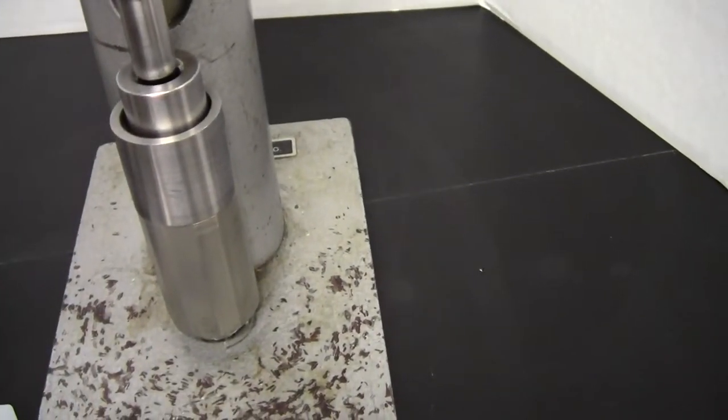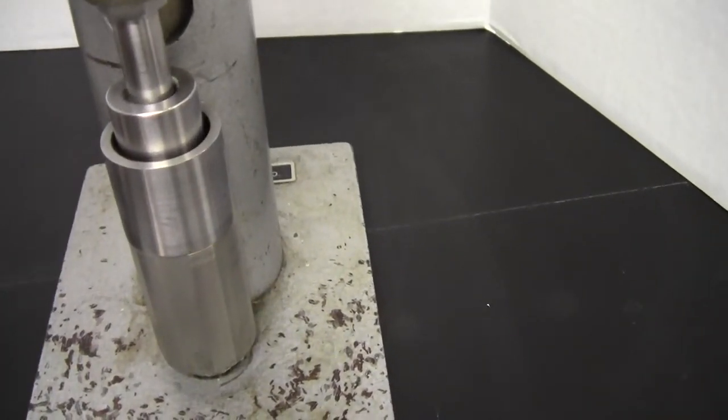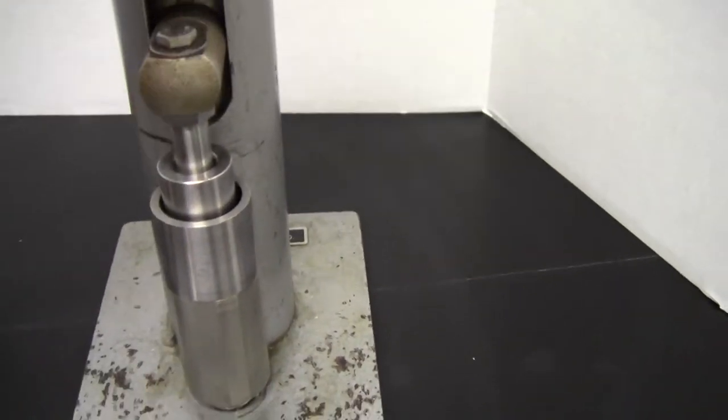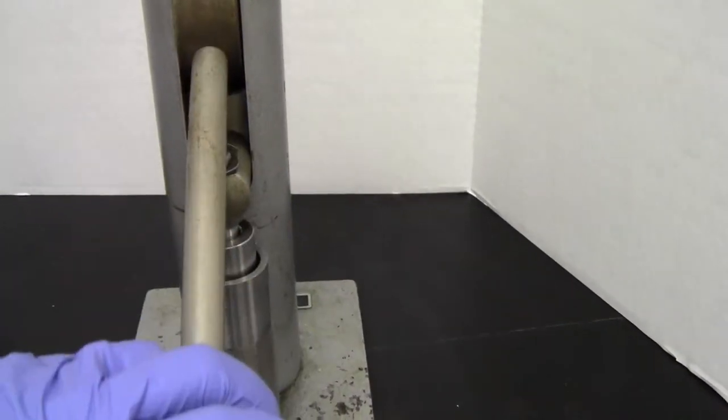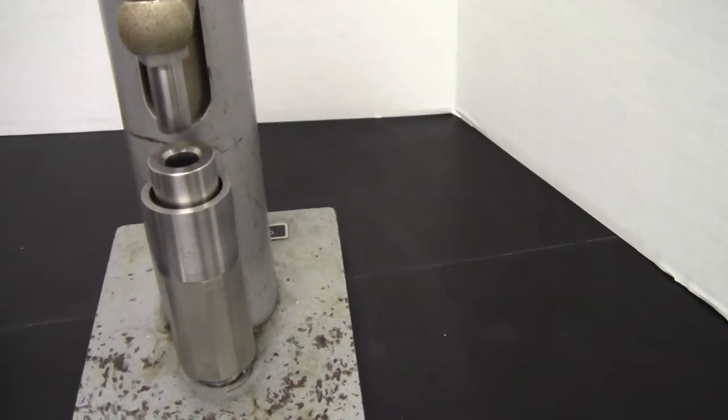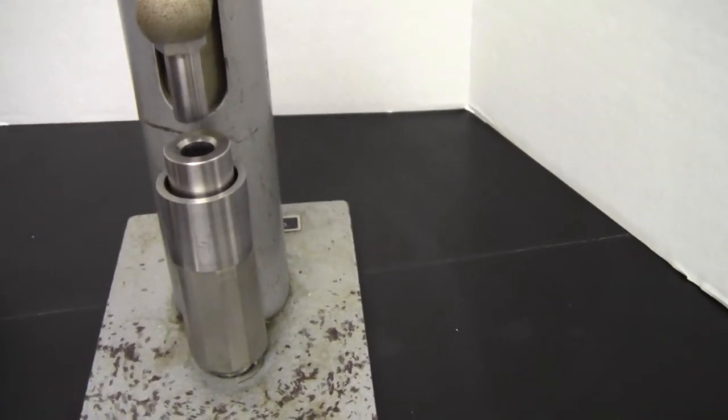And I'm doing this with one hand to show you here, but that's going to guide in. Should be in the center. And press that down. There's nothing in it right now, so that presses very easily. But you'll see when you have your benzoic acid powder in there, you'll press it into a pellet. It looks like a little white vitamin pill.